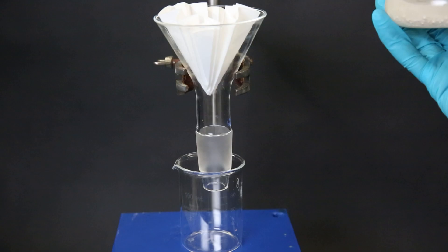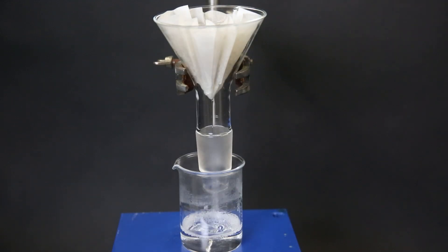So to catch all the pieces and recycle the dioxane I poured it through a paper filter while leaving behind the denser magnesium in the flask.